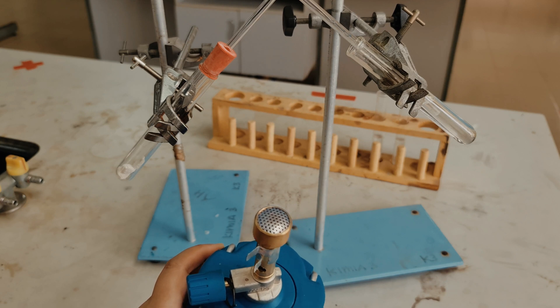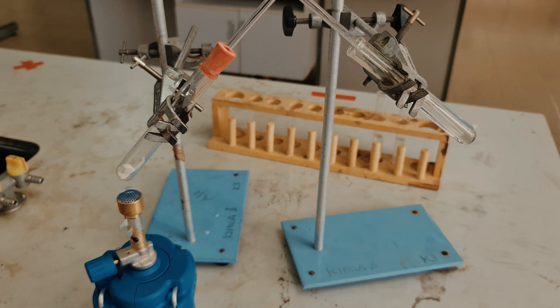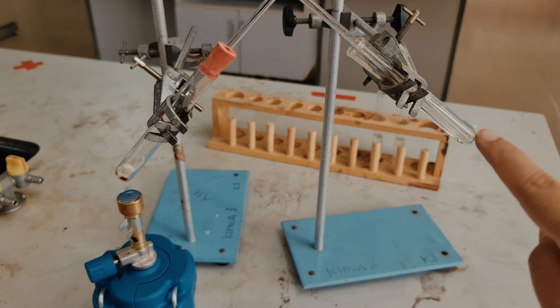You can see there are air bubbles coming out already through the delivery tubes.